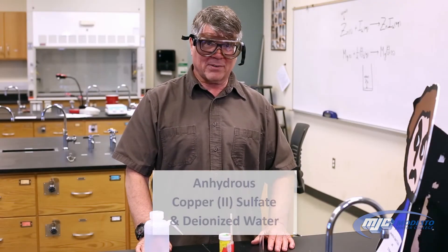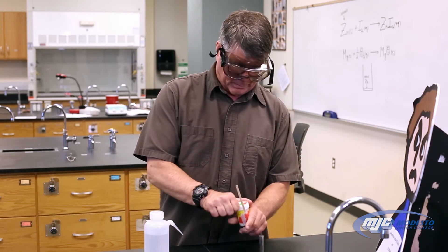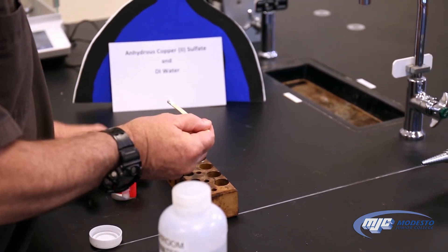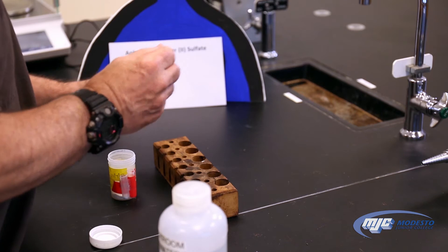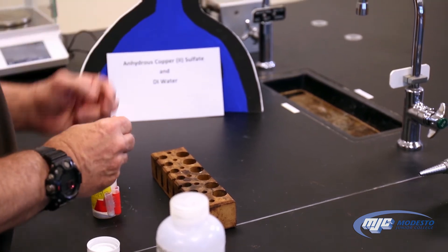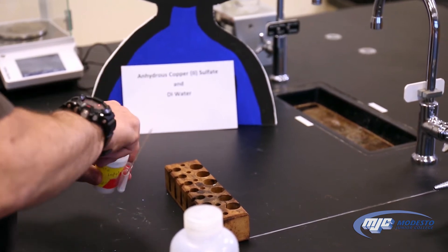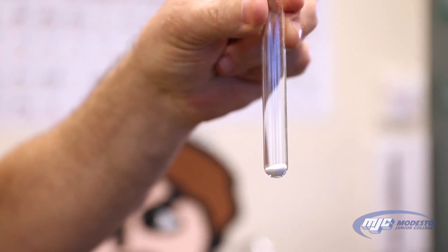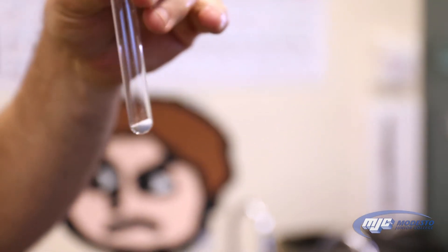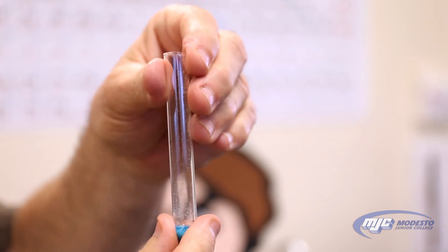This is the reaction, if any, between anhydrous copper(II) sulfate and DI water. As always, put the lids back on the containers. That is hot.